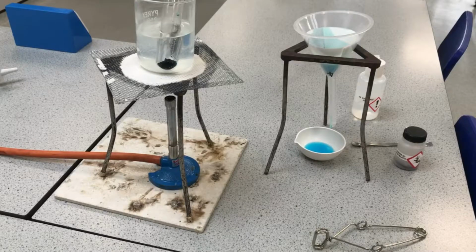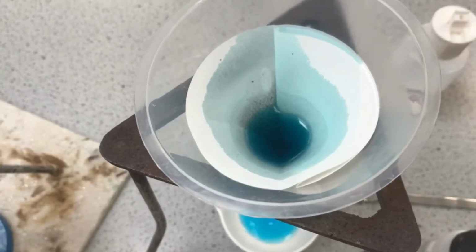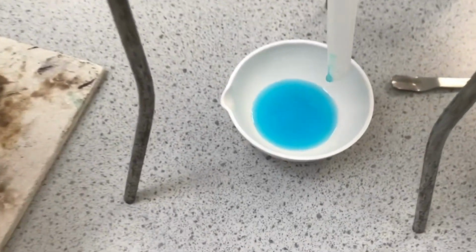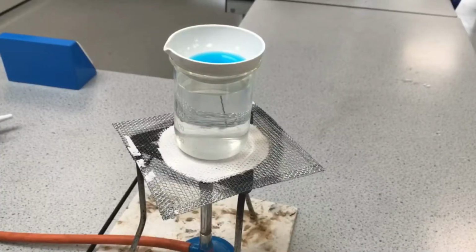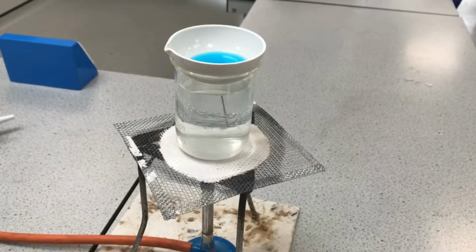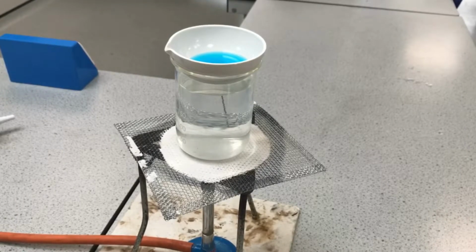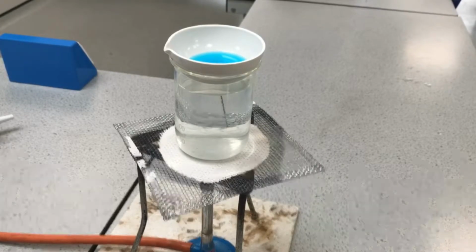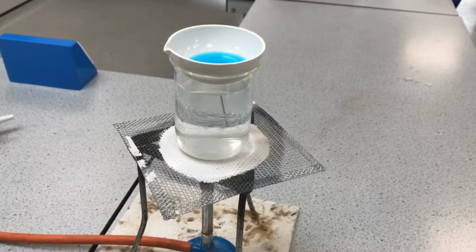Okay, let's just go a bit closer so we can see that solution. So you can see there is the trapped copper oxide in the filter paper, and there is my pure copper sulfate solution. Just thought I'd use this opportunity to show you how I could heat it to speed up the process to get those crystals quicker. And this is called a bain-marie. It's basically using a beaker of hot water, kind of in the way you would melt chocolate at home if you were doing some cooking. And this can just gently heat the copper sulfate solution to get those copper sulfate crystals.